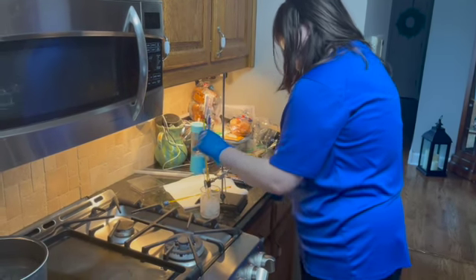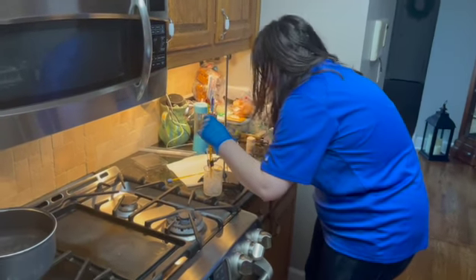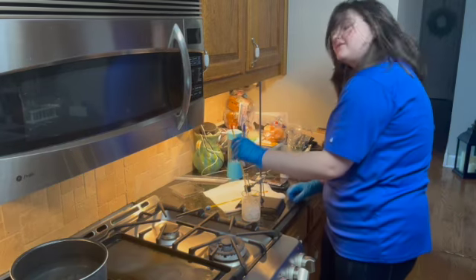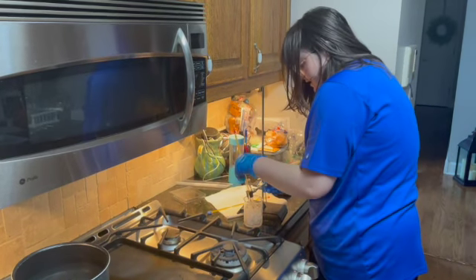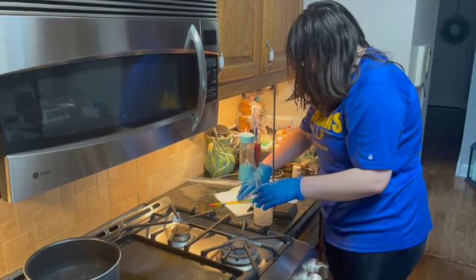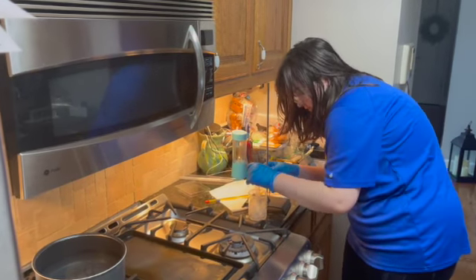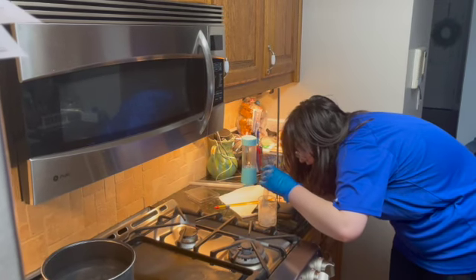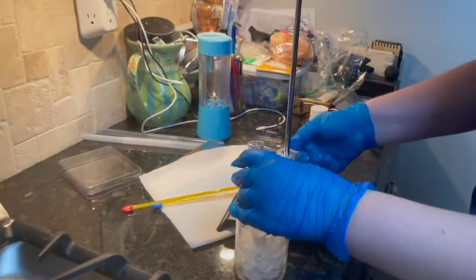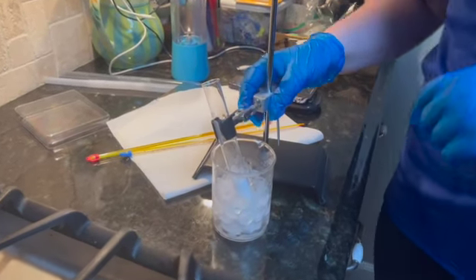So we're getting close to the 7-minute mark, and our temperature is at 26 degrees Celsius, and I really need to check it again to make sure. I'm going to have to take this out for a second and check, because I think it's completely frozen over. So let me check this. Yes, it has been completely frozen over. So at 7 minutes and 25 seconds is the time that it has completely frozen over.